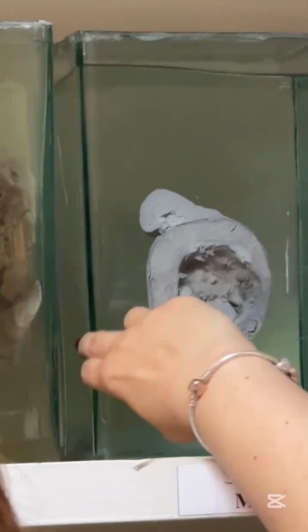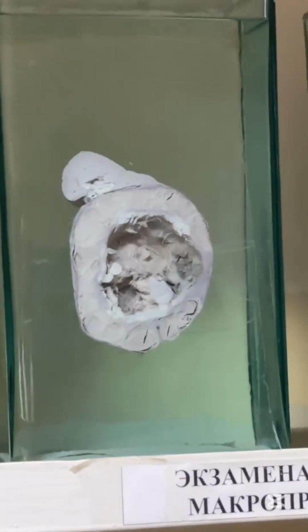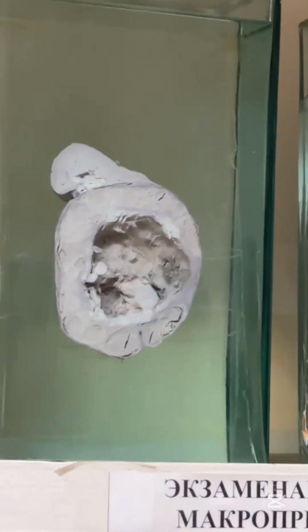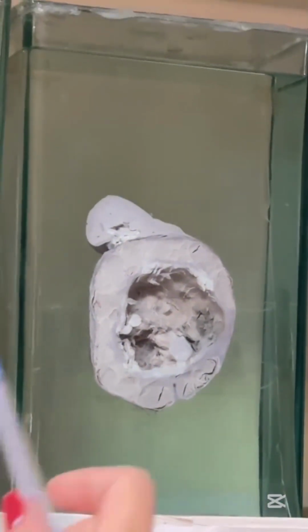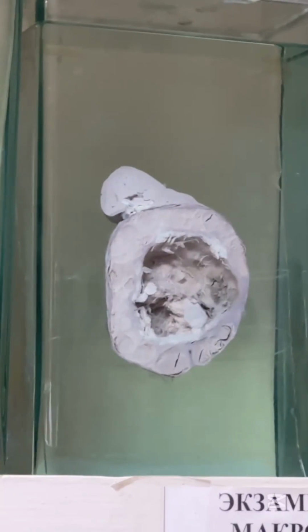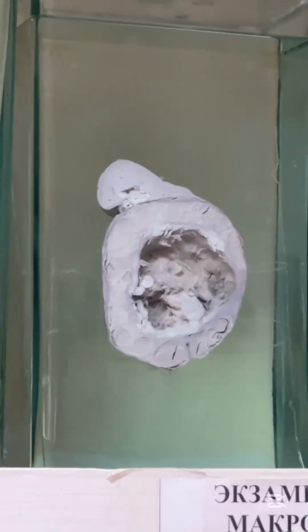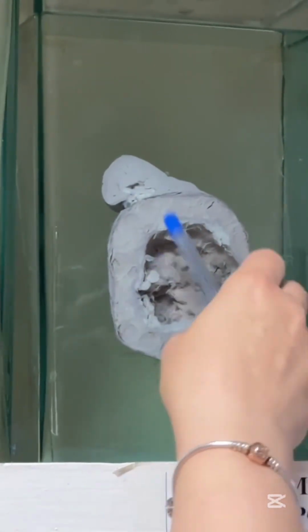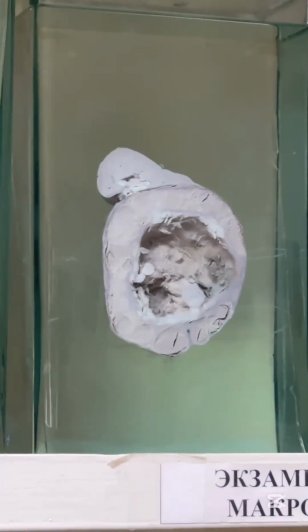Next one is kidney. That is normal part of kidney, that is tumor. You see that normal part is small, so that was baby. Most common kids tumor, nephroblastoma or Wilms tumor. It is malignant tumor, but it is encapsulated. It is called pseudocapsule. We can't call it true capsule because it is malignant tumor. So that is exception. Malignant, but expansive growth like benign, because of pseudocapsule. In the middle you can see focus of necrosis. That's why cavity.